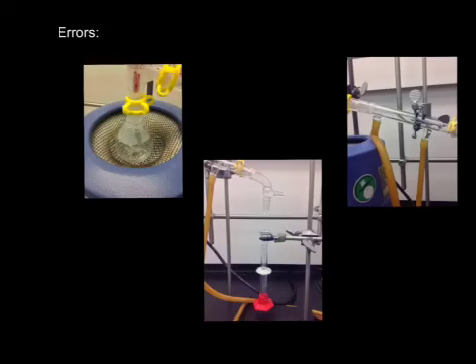Also, the flask not touching the heating mantle could have played a role in allowing the ethanol to be distilled from the water. And finally, the graduated cylinder hanging when collecting the distilled ethanol could have lost drops, in total losing some volume.